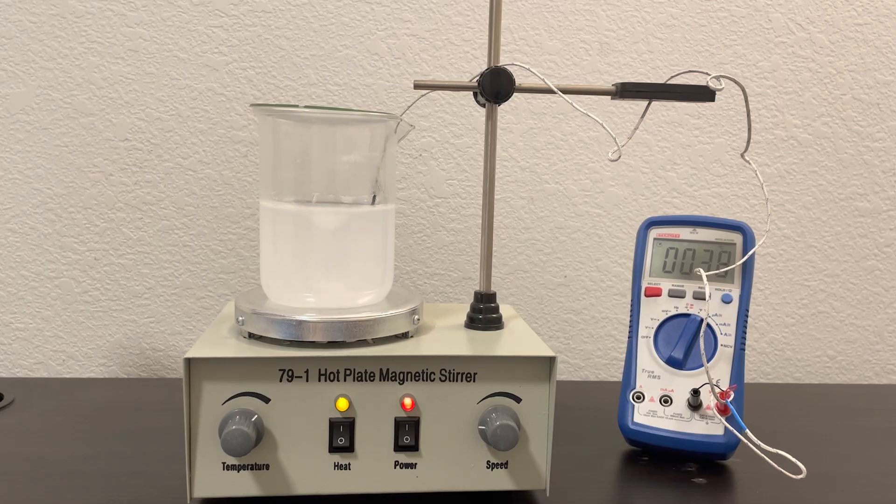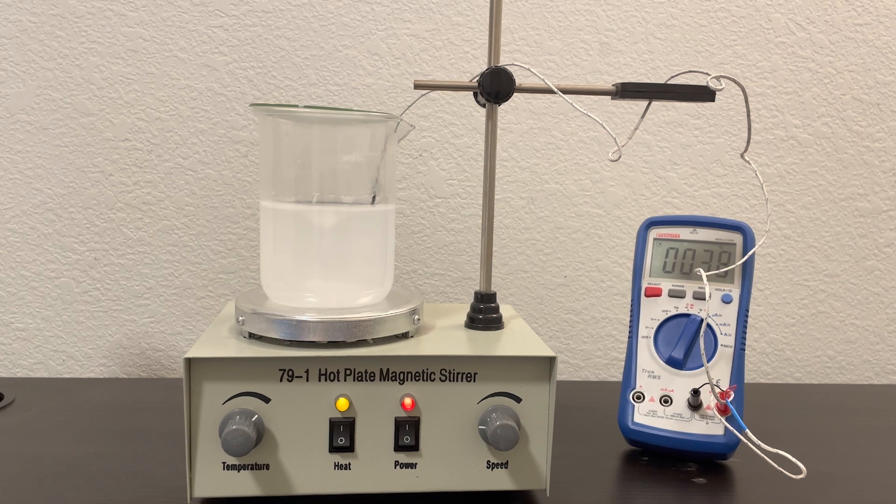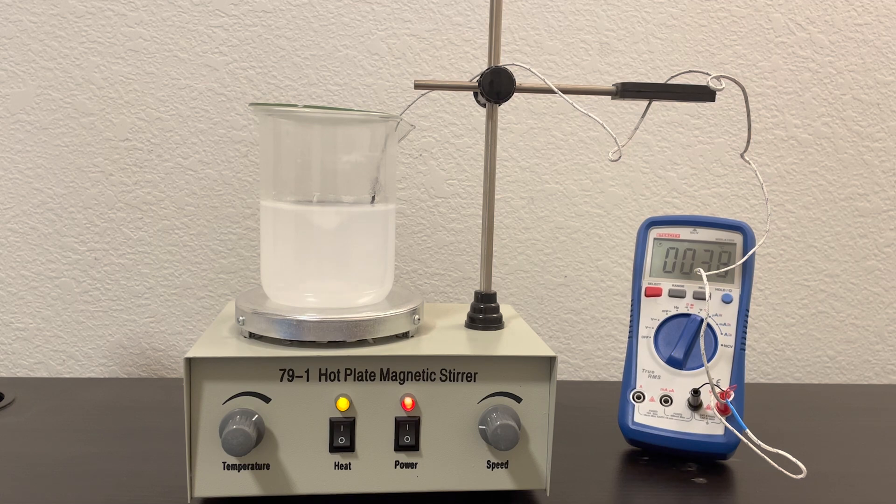Here's some footage of me trying to dissolve the barium hydroxide by heating and stirring. And you can see that it really doesn't like to dissolve.